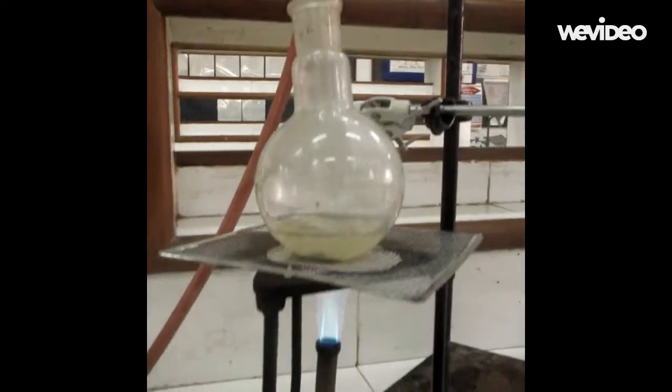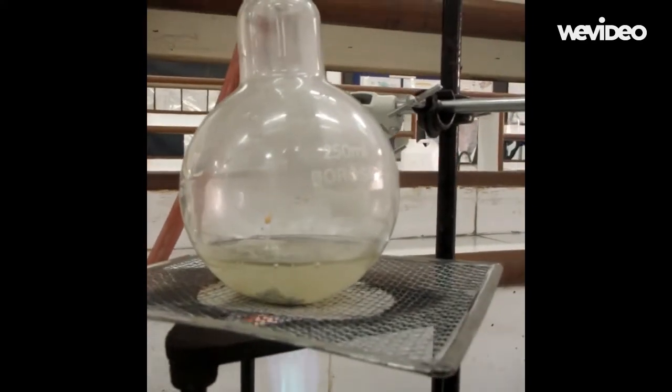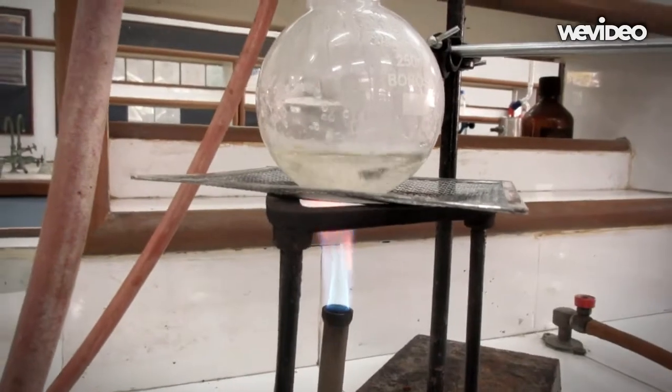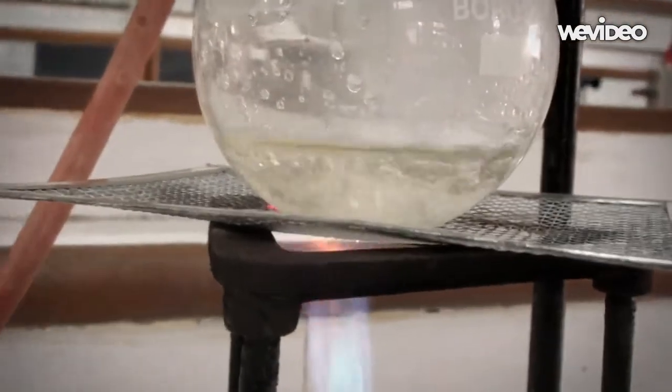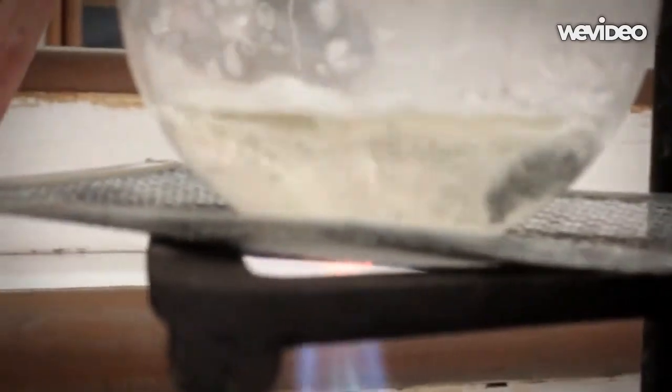After heating for about half an hour to 45 minutes, let the flask and the contents cool down to room temperature.